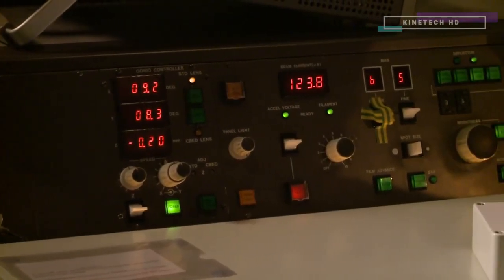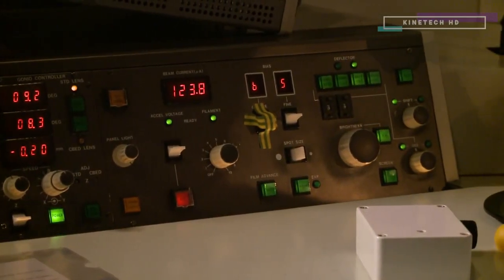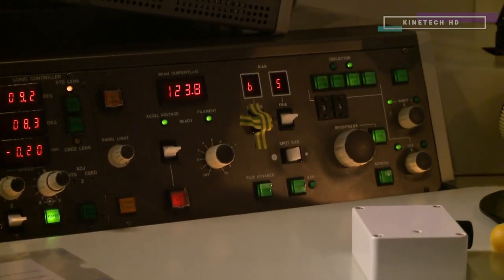There's a lot of computer control — you can see the illuminated LED panels and lots of computer controls here. Initially it was all mechanical — everything was mechanical. You had to operate the strength of the focusing lenses by turning dials which mechanically changed the currents going through them, and now it's nearly all electronic. A huge difference.